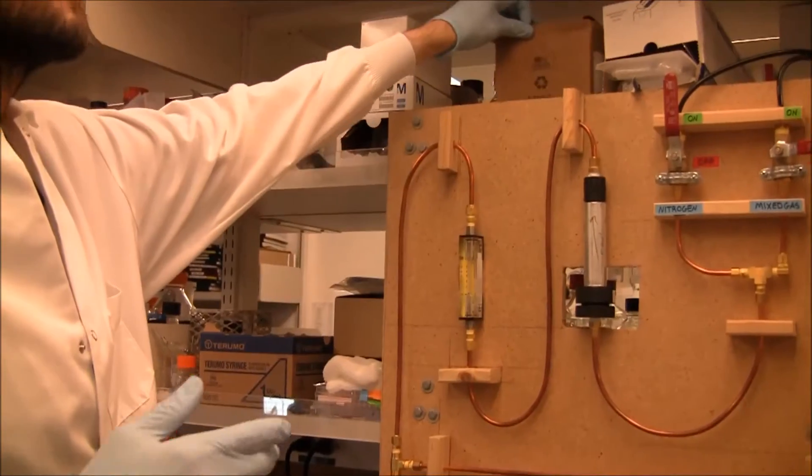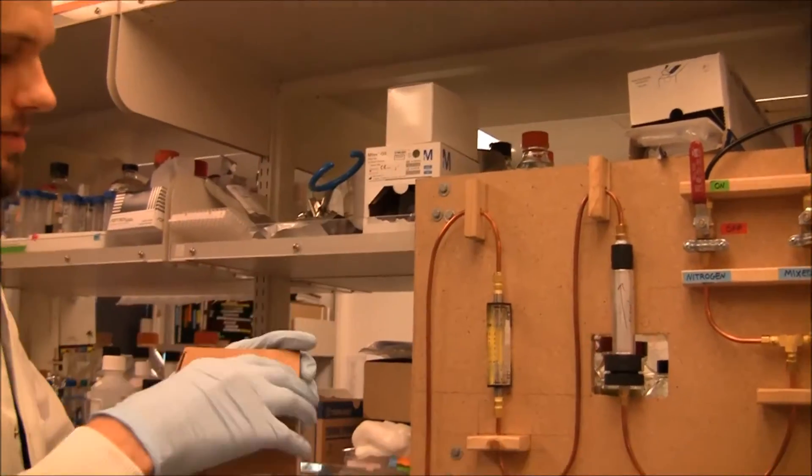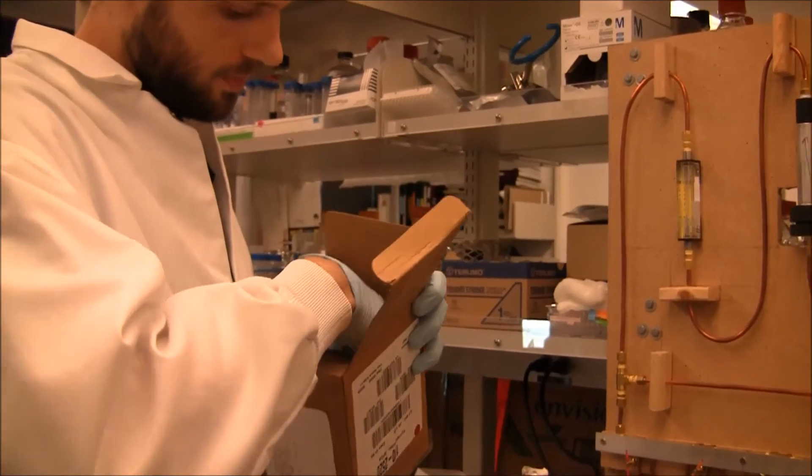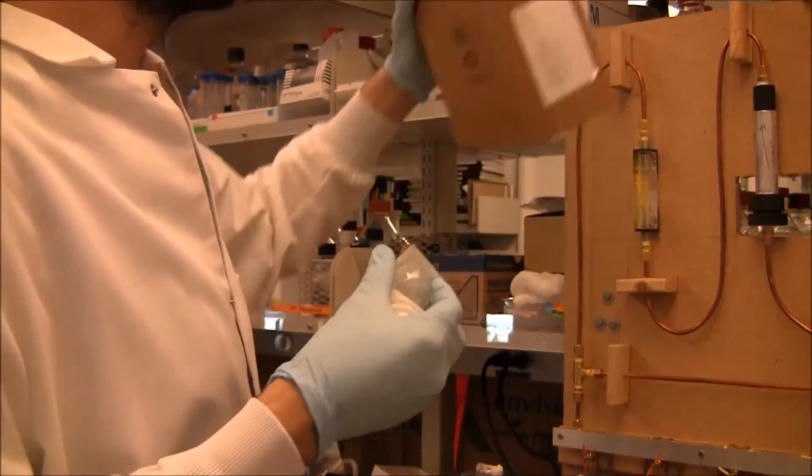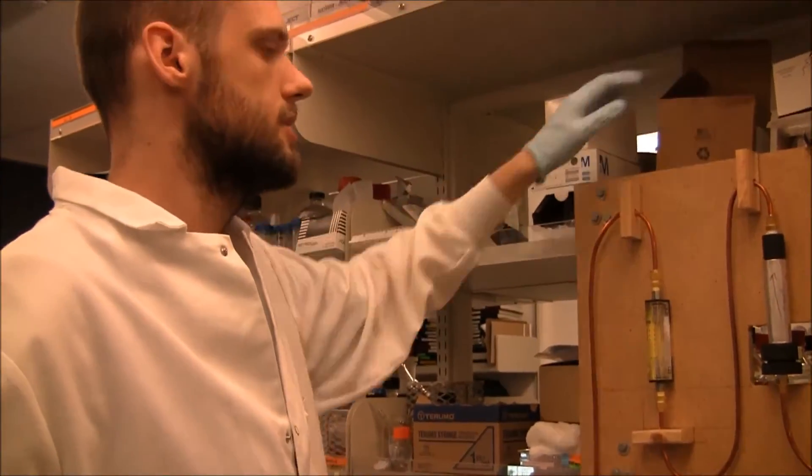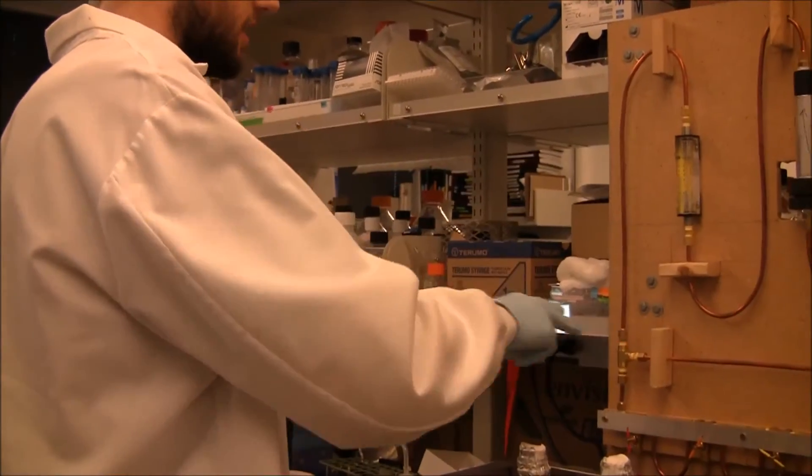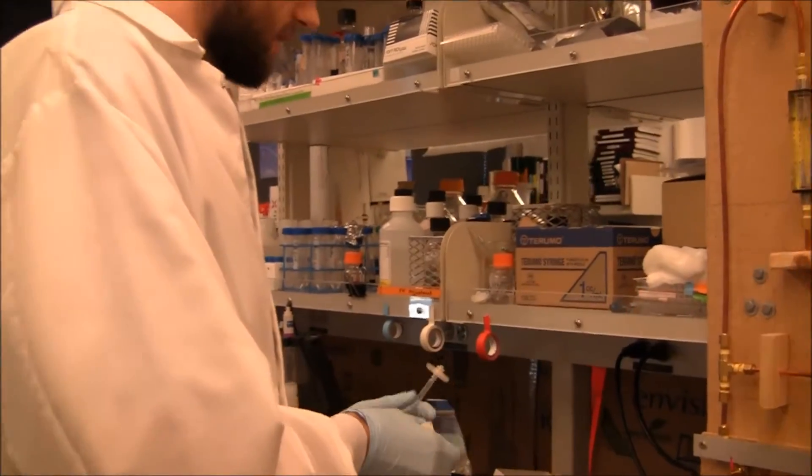And here's what I do, it may be superfluous, it may be excessive, but, so we take 0.2 micron filters, just on the very minimal chance that there's any kind of bacteria in here or in these lines.